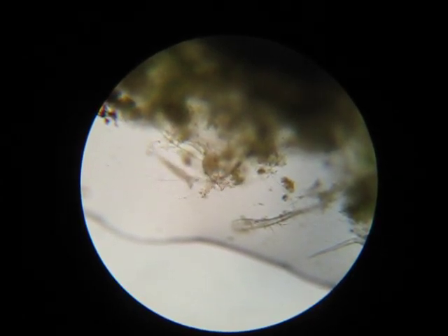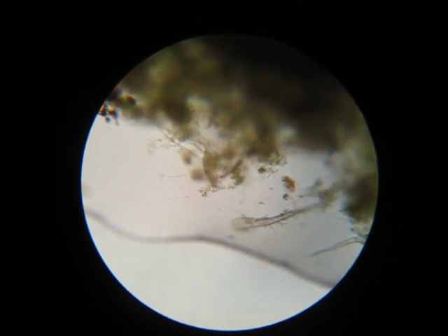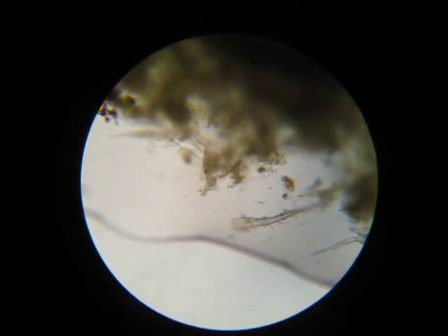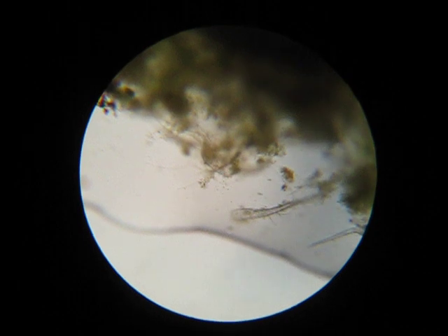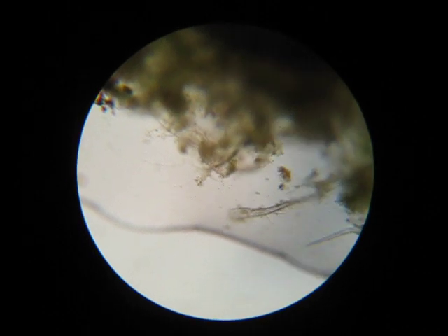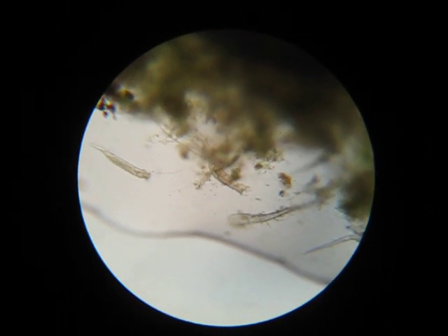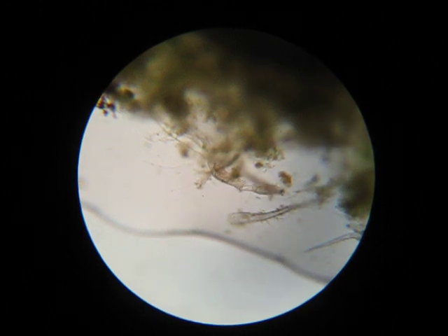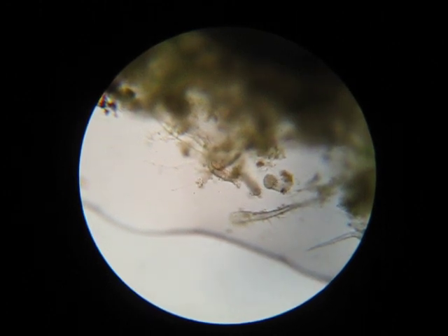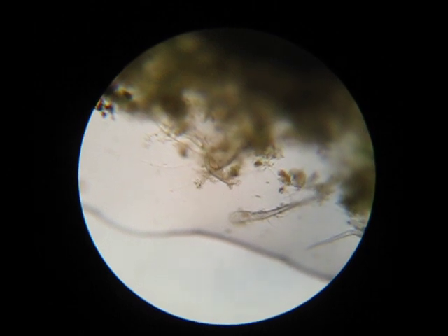There is a striking contrast here. Packed with internal structures, a eukaryotic cell is far more complex than the tiny prokaryotes swarming in the culture. The waters of a billion years ago must have been a natural laboratory exploring the possibilities in this new form of cell life.